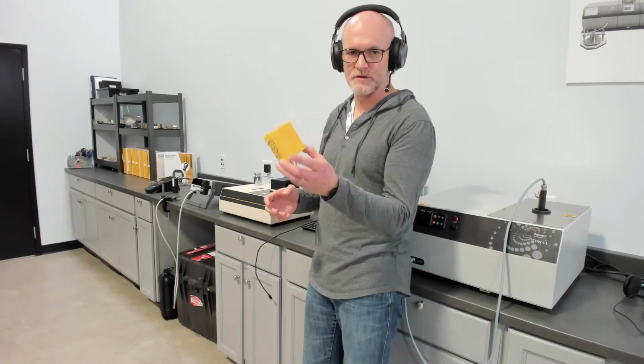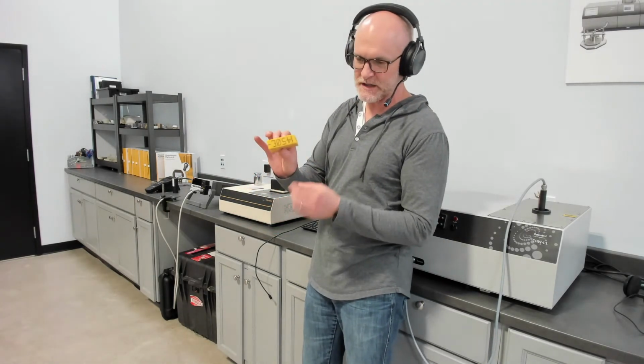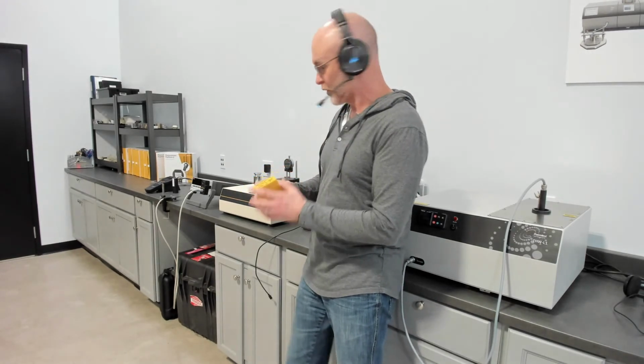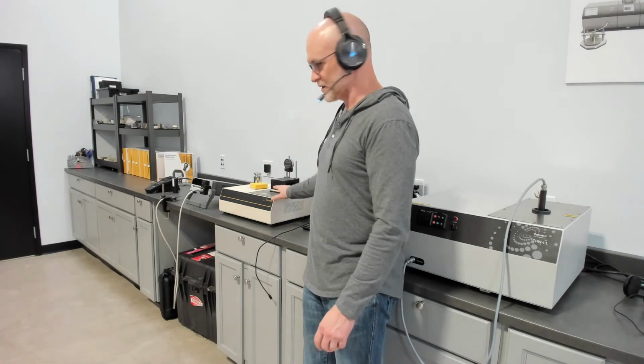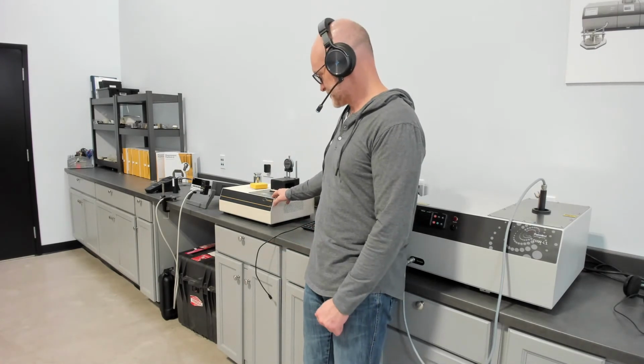This is a typical small sample, but of course it can do much larger. The maximum opening is 1 inch. So we developed this really because of the overuse of transient methods for measuring small format insulation. So we developed this to be able to measure with a more suitable method for such materials.